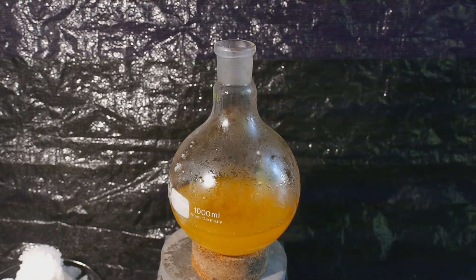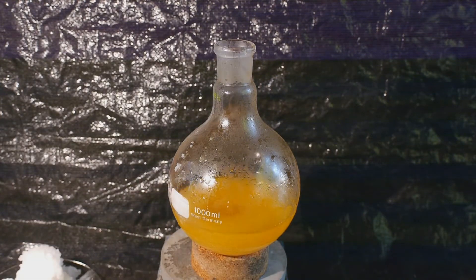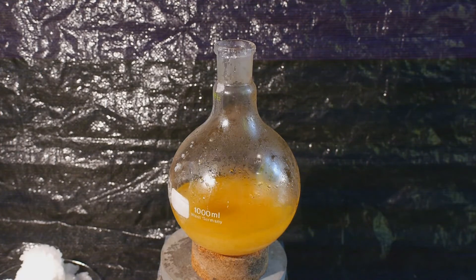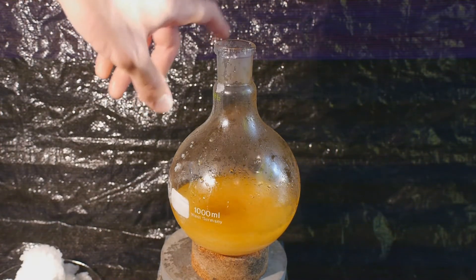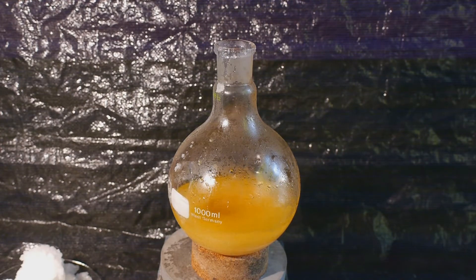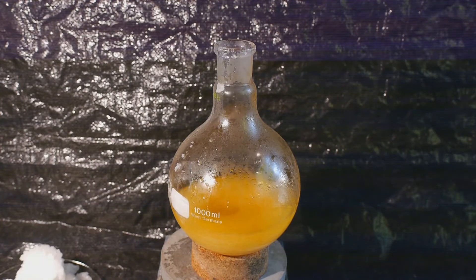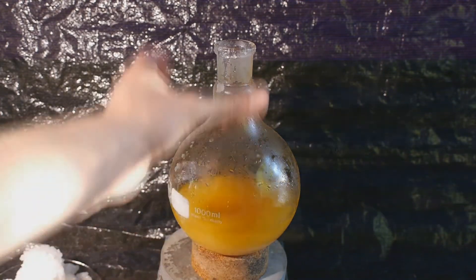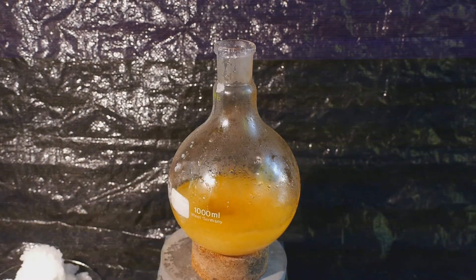Must be some sort of complex in solution. Let me just hope to God this doesn't end in a giant catastrophe. Oh, I know what's going on. It must be the sulfuric acid that's stuck up here in the neck of the flask. It's reacting with the sodium bromide and that's causing some of the discoloration and smoke. Down here in the solution it all seems fine.